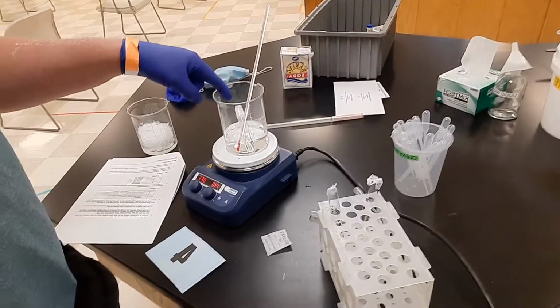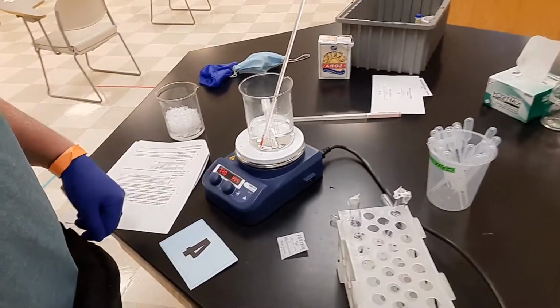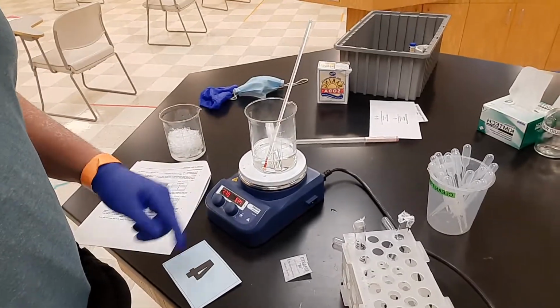This is especially crucial where I need a good labeling system, because once I have 5 test tubes in here, I'm not going to be able to tell which is which. When this is done reacting, I'll make a video trying to show the process.